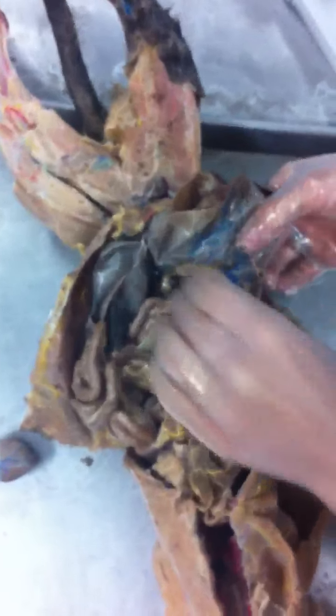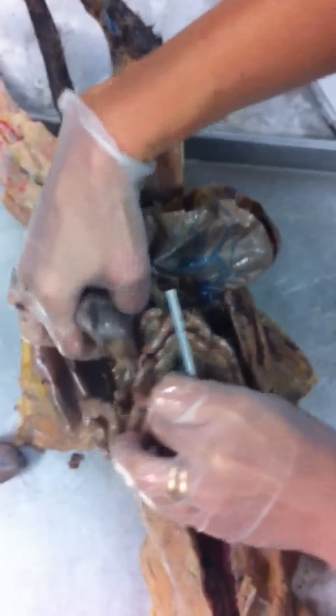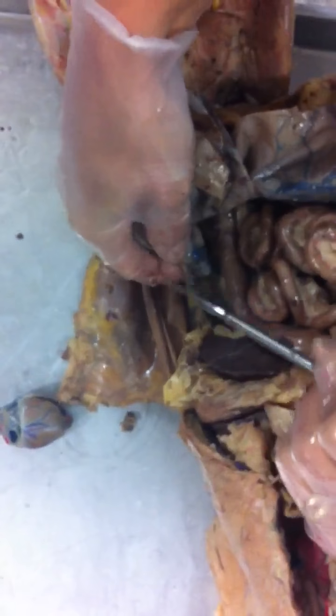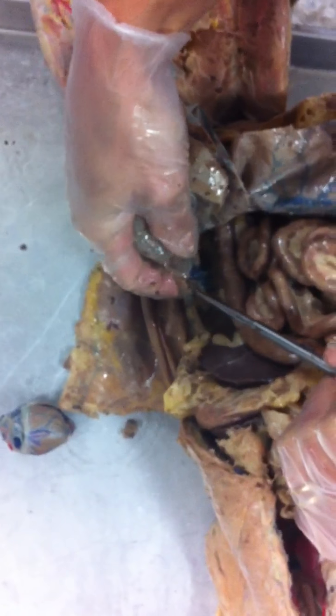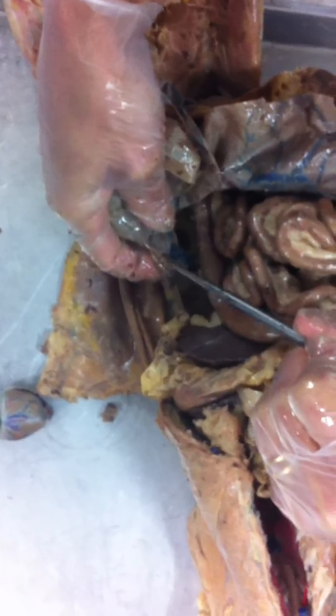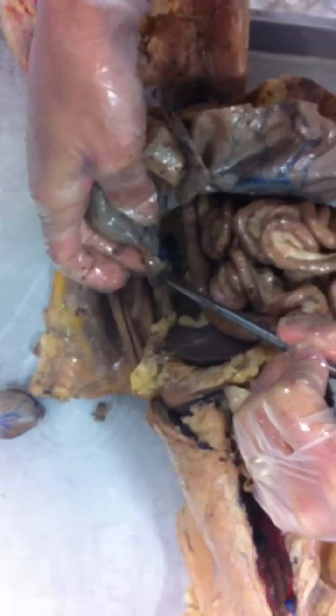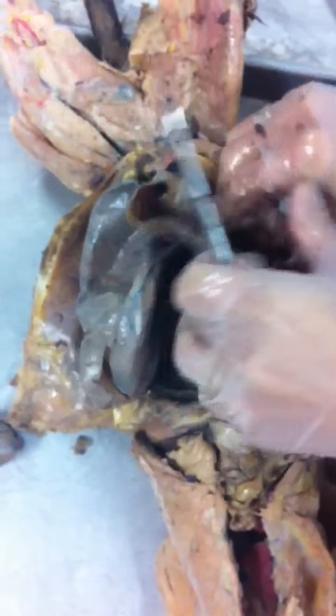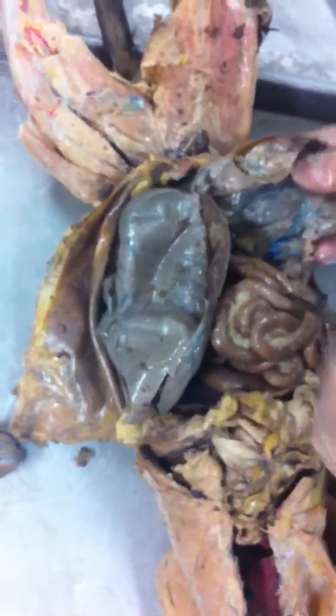For the reproductive female parts, let's see if we can find a good one here. If we start up here at the top, again, a small bean-shaped structure. That is the what? Ovary, and then all of this surrounding tissue here. Fallopian tube. What do we have here? Uterine horns, or horn of the uterus. I need to know something about uterus and horns, so figure out a way to put those two words together. On this side, same thing.